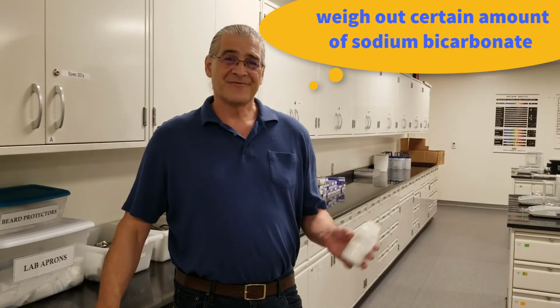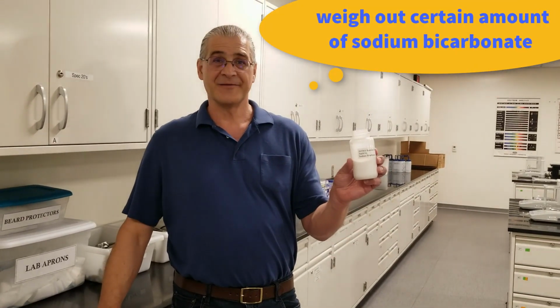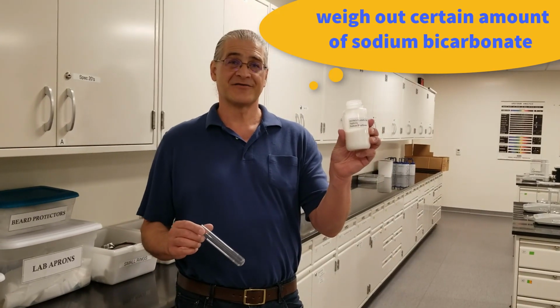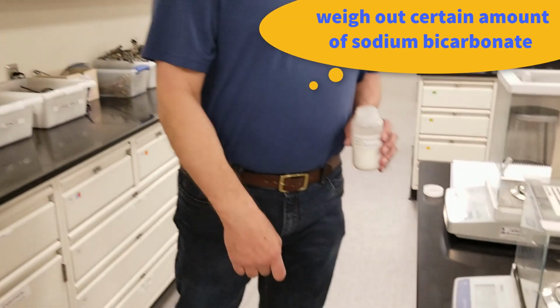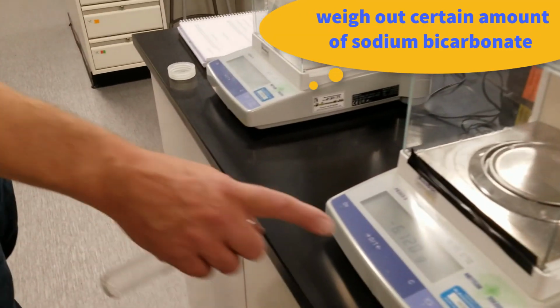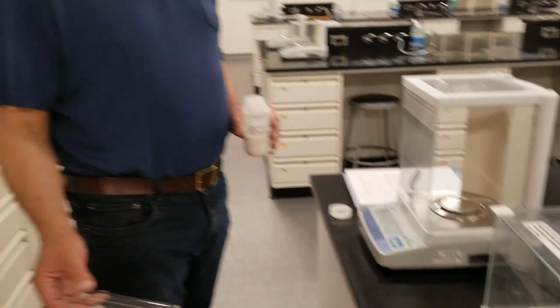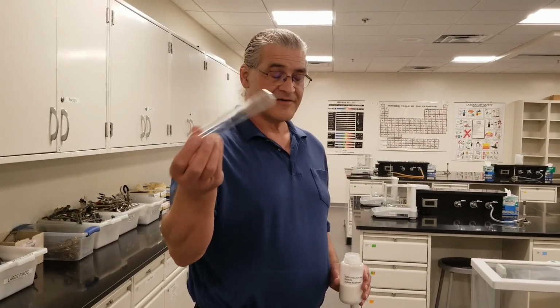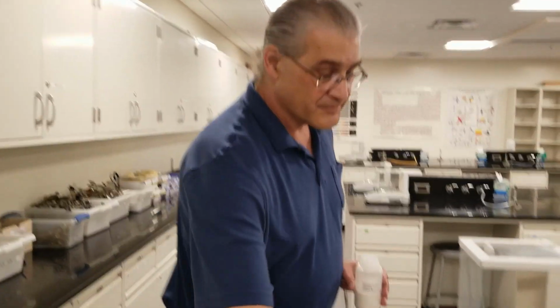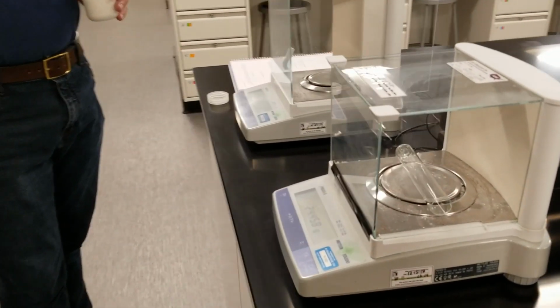Okay guys, for the first part of the experiment, you have to weigh out your sodium bicarbonate. So you have to know the exact mass of this you're starting with. You start by taring the balance. See how that sets the balance to 0. Then you're going to weigh the empty reaction vessel. Your reaction vessel is this big test tube. So you weigh the big test tube, get the mass of that.